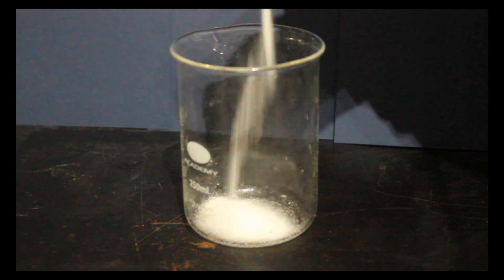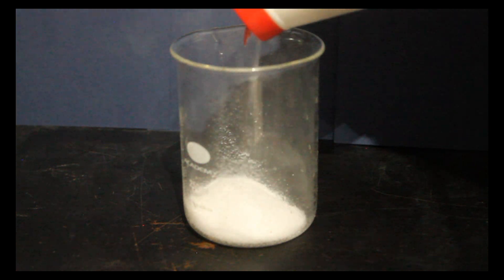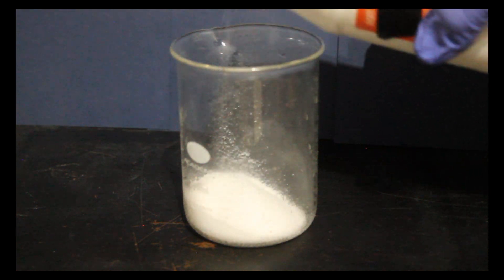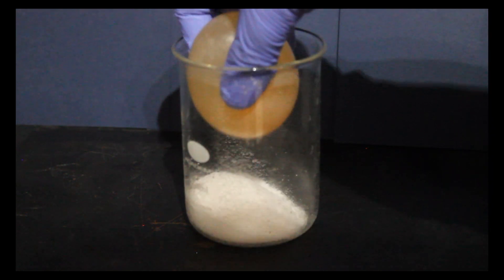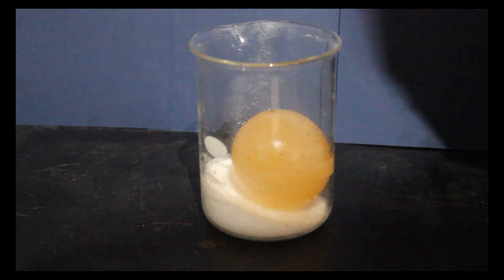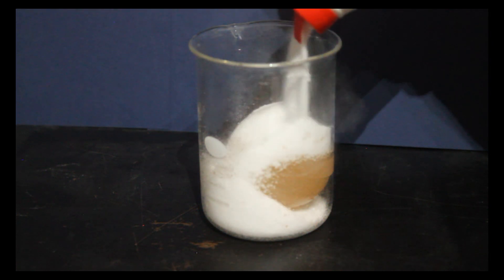For this we will fill the bottom of a beaker with table salt, place our shell-less egg on top of the salt, and then bury the egg in table salt.